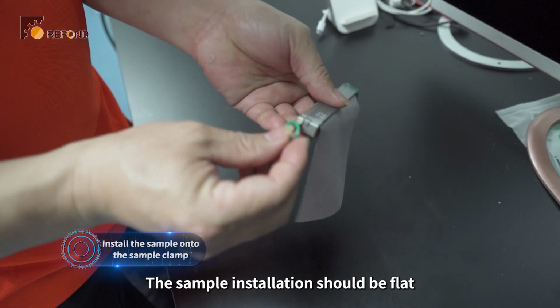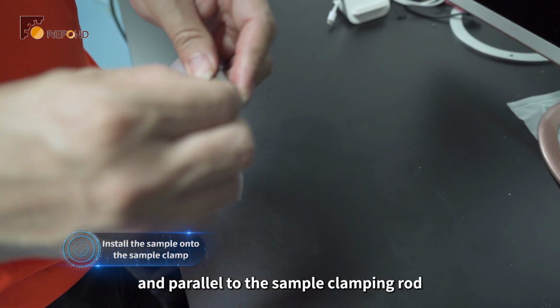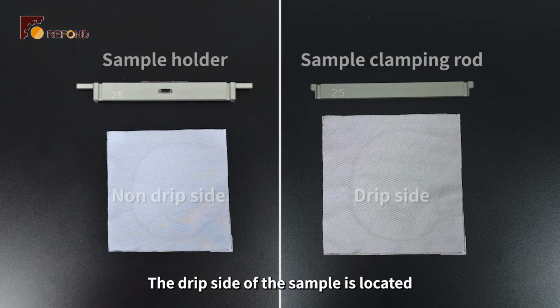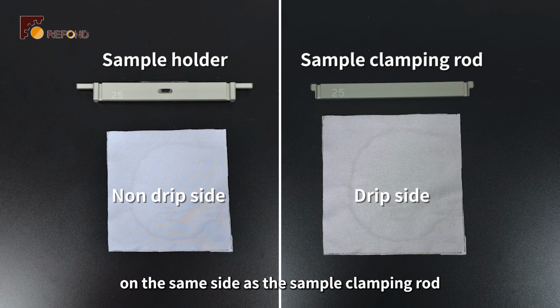The sample installation should be flat and parallel to the sample clamping rod. Prepare all the samples that need to be tested at once. The drip side of the sample is located on the same side as the sample clamping rod.